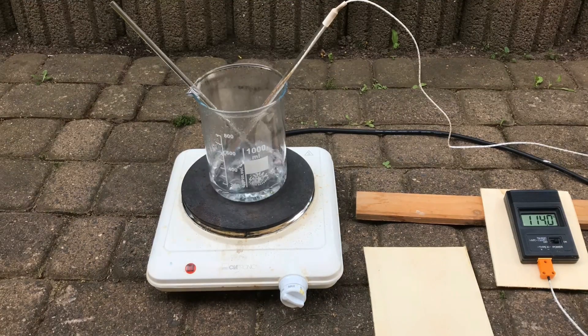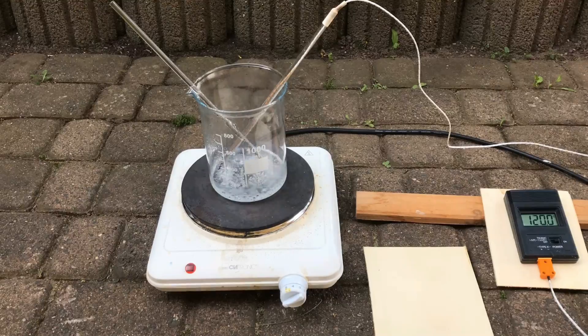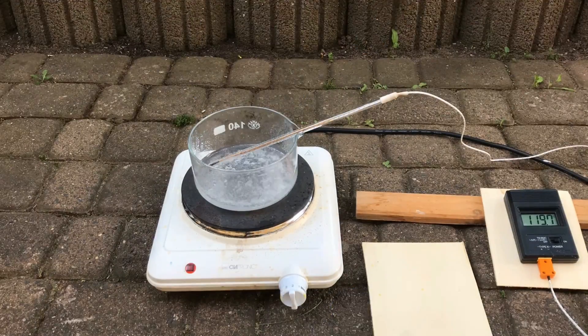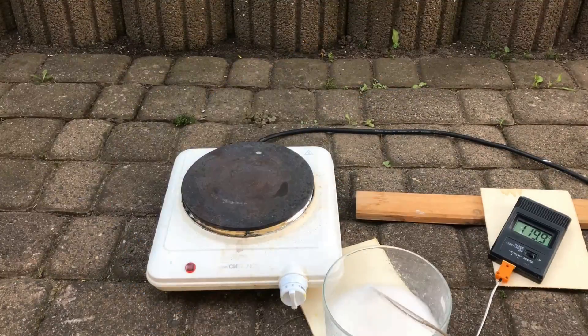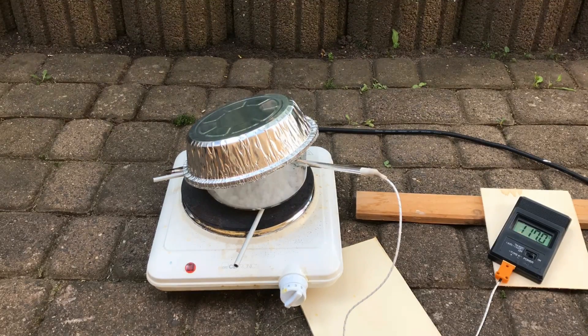A while later, I transferred the sodium formate solution to an evaporation dish for more efficiency. You should normally use an oven to continue drying it in the end, but I decided to do this.